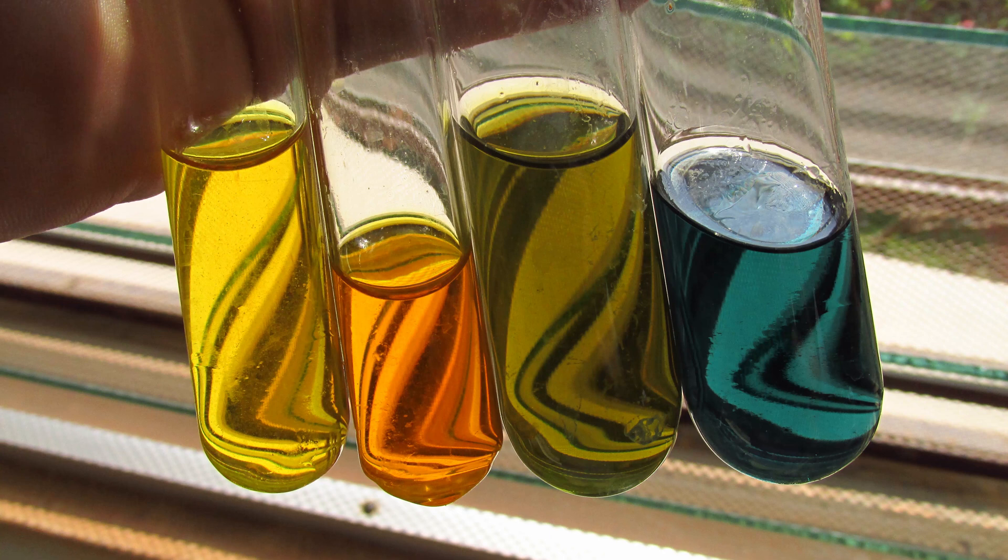So here, that's our end result. You can see beautiful colors, and I'm going to explain how they come about.